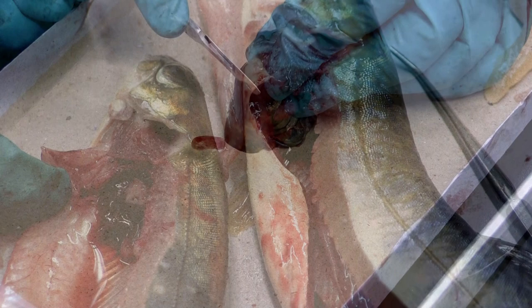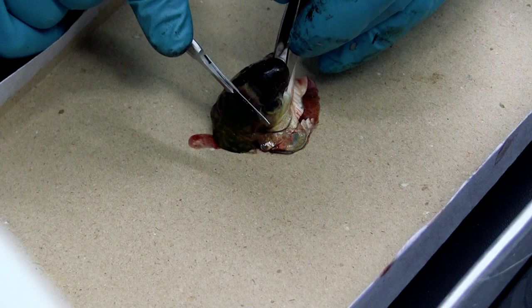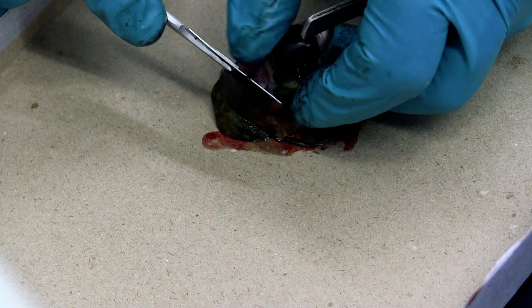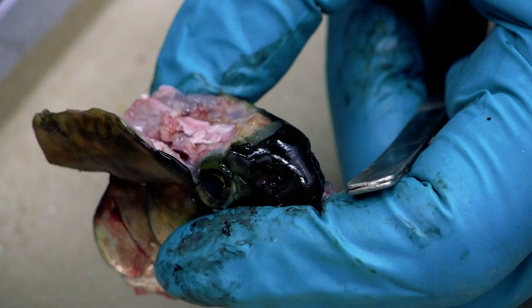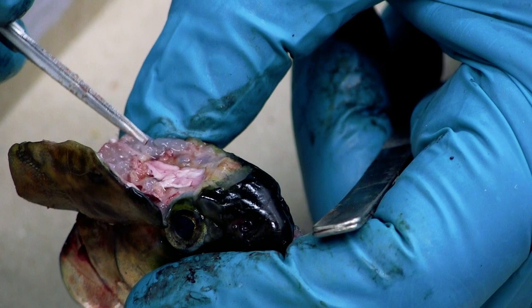For the brain, to be safe, grab the fish with forceps and cut the top off the head — within there you should see the brain. The brain is a really important organ for some of our diagnostic tests. We're looking for any signs of hemorrhage; some bacteria and viruses like to focus in on brain tissue.